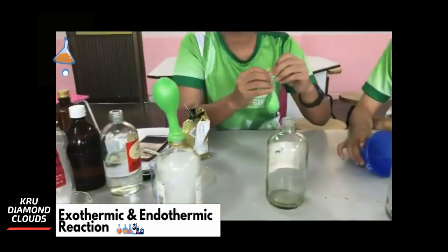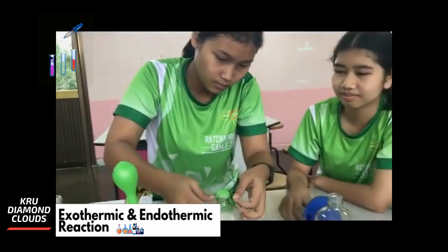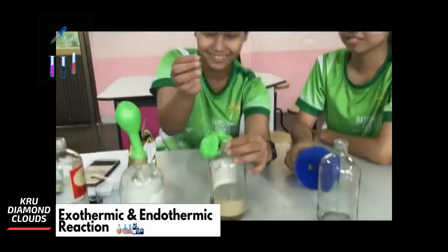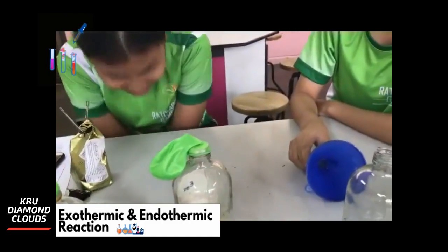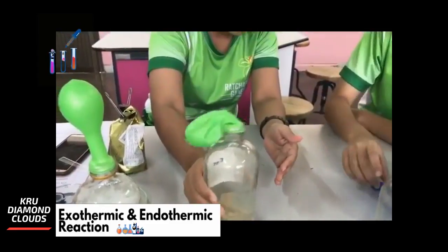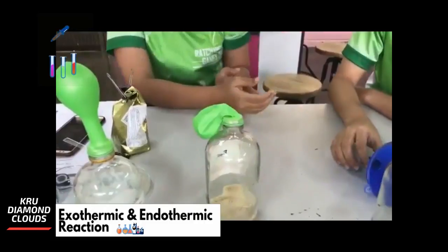Connect the balloon just like you did for the carbon dioxide gas. Now lift it up and let the reaction begin — it's showtime! Nothing yet, just wait. You can shake it a little bit. Leave it — enough.